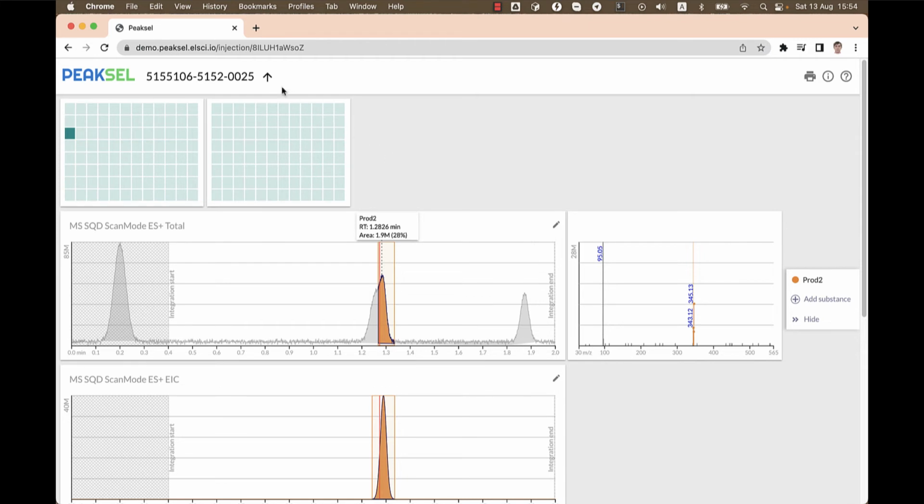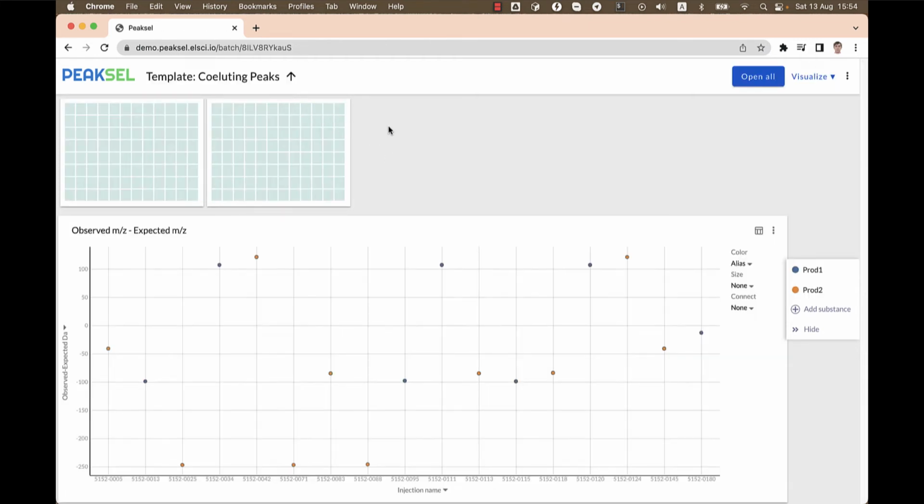Let's go to the batch level because we want to leverage visualizations in order to spot all such cases within a batch. Here, I've already prepared a chart that shows the difference between peak BPM and exact molecular weight of our compounds. I've already filtered out all the good peaks and left only bad ones. So if we select all these points, we can see that there are 17 injections where peak BPM is not the same as expected molecular weight. If you're using our demo instance, you can simply apply this template into your batch and see it right away. But I'm going to go through the details of how you can create such charts yourself.